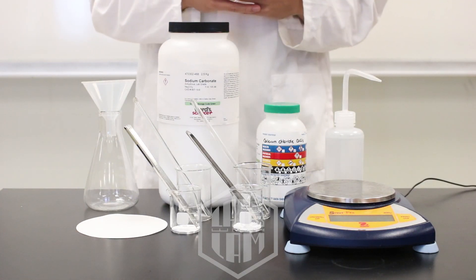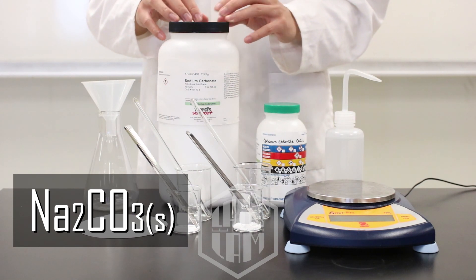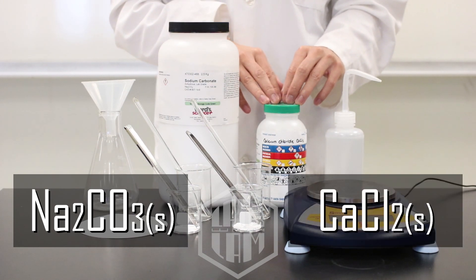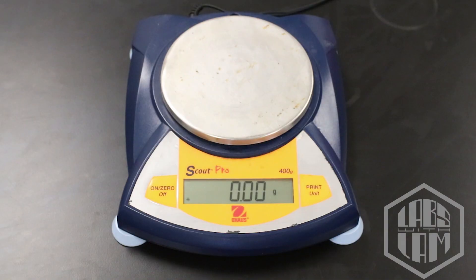Alright, so the reaction we're going to be looking at today is between sodium carbonate over here and calcium chloride right here. But before we conduct the experiment, we're going to need to weigh everything, so let's go ahead and do that.